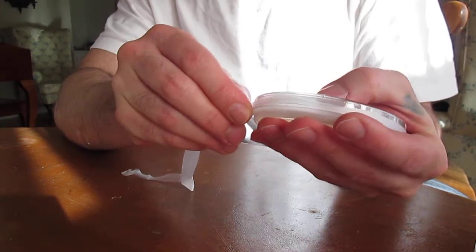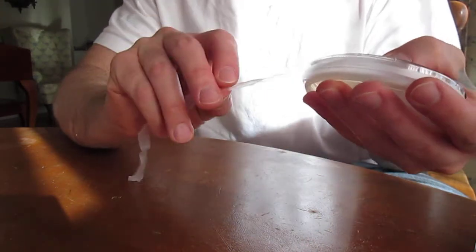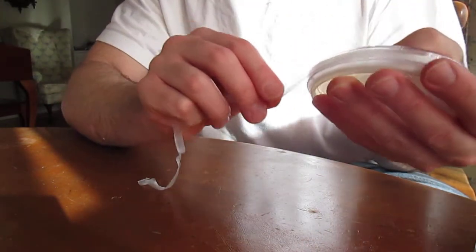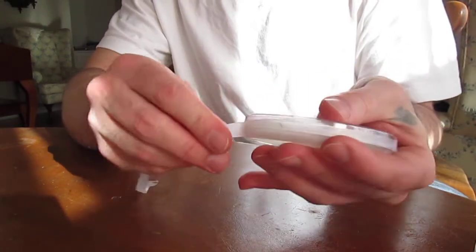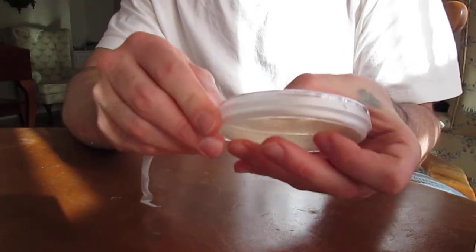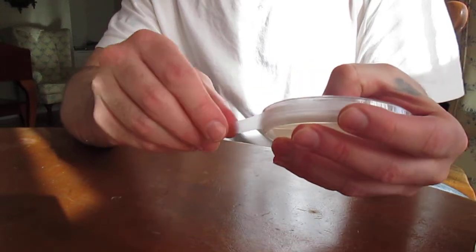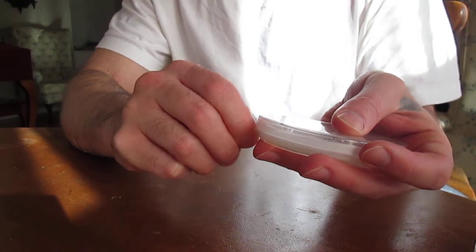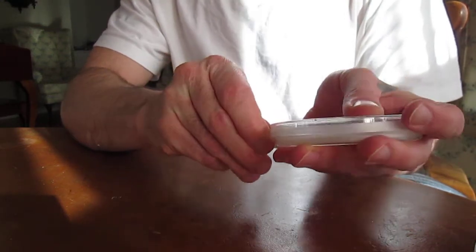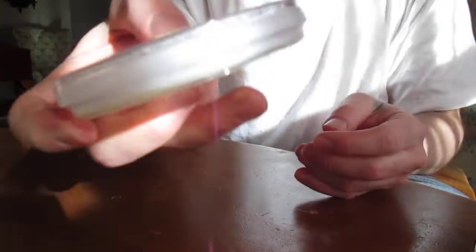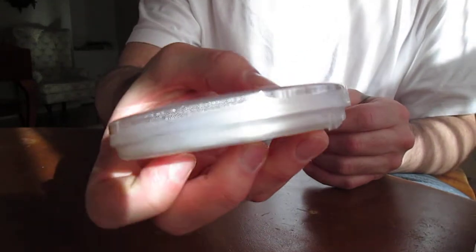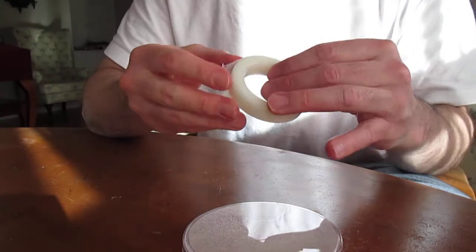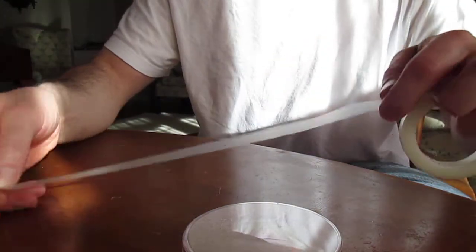It's better to find out before you decide to transfer any mycelium or use them for any other purpose. Here's another one right here. I'll do it one more time. You see, I pulled that much. Stretch it out.